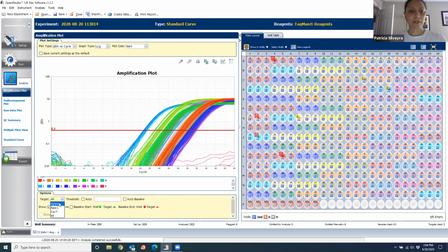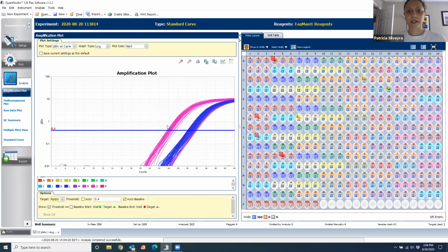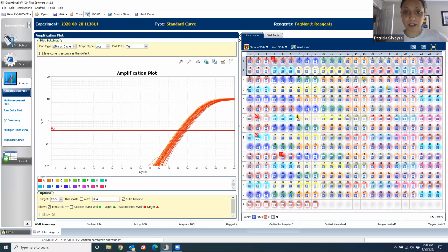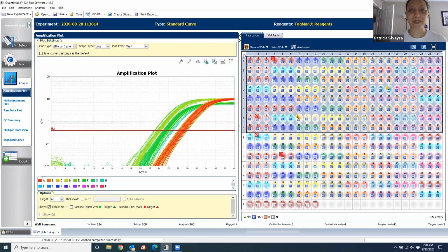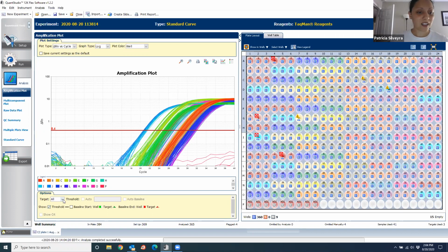So for example, for the housekeeping control, you can see here two populations of genes. The pink one and the blue one, I assume those are the liver and the testes. And you see a little bit of pink over here. This is probably the non-template control. Or it may be some sample that just expresses less or has less amount. I don't know. We will have to analyze the data later.